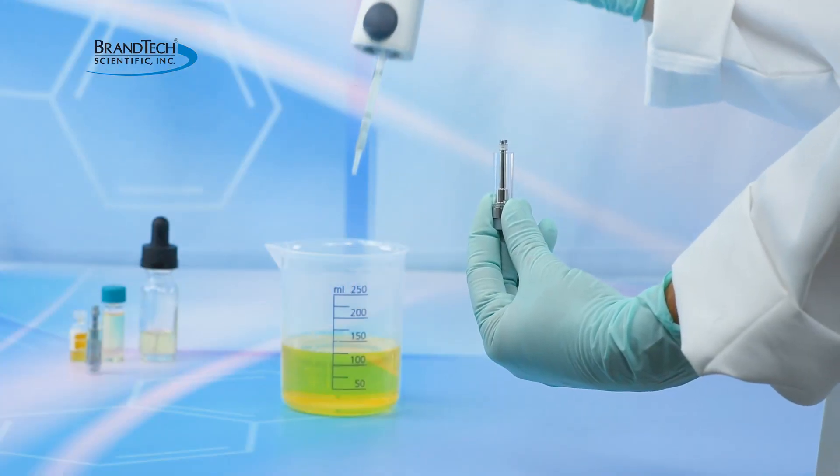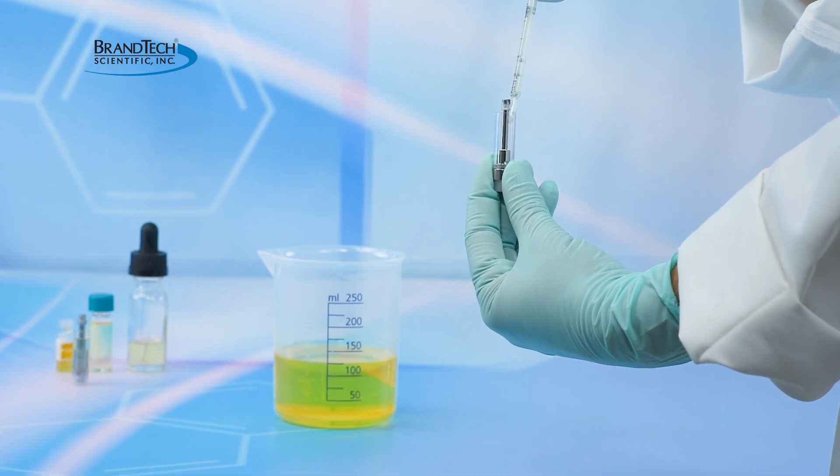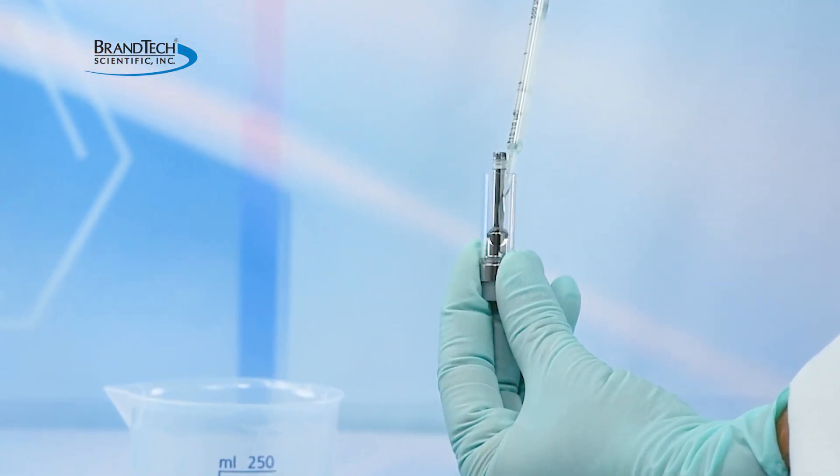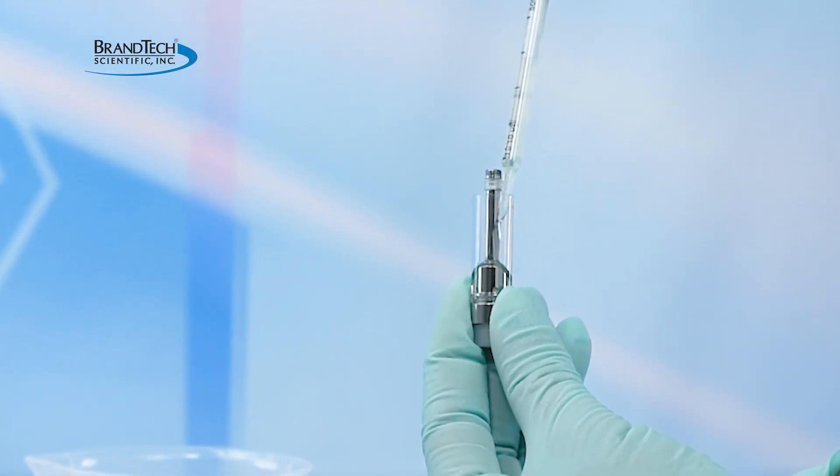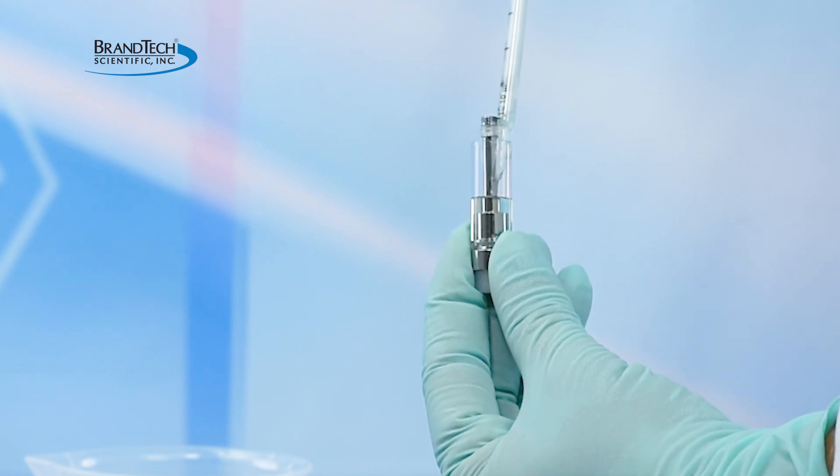To dispense the liquid, simply insert the tip into the vial or cartridge of interest and push down on the dispensing lever. The liquid will be dispensed into the vial or cartridge.